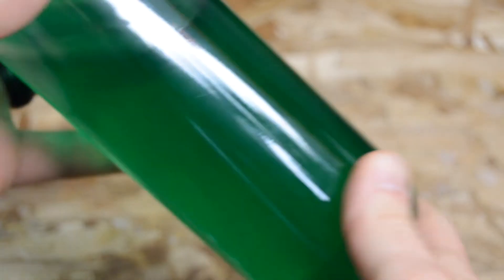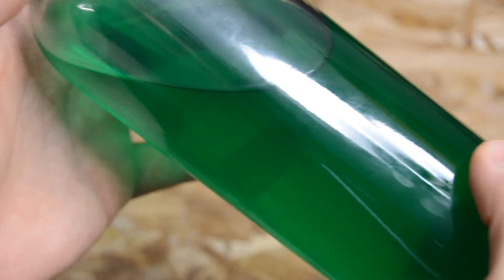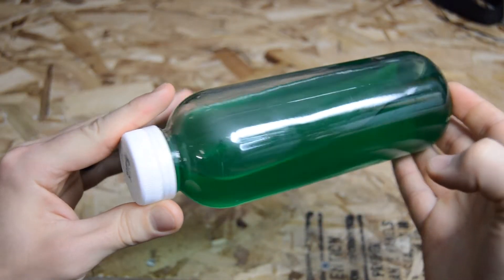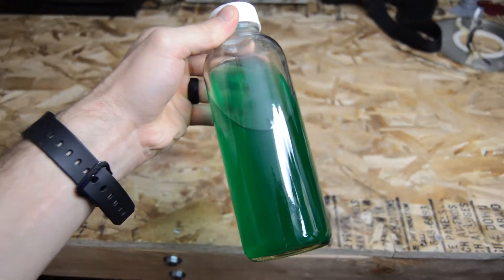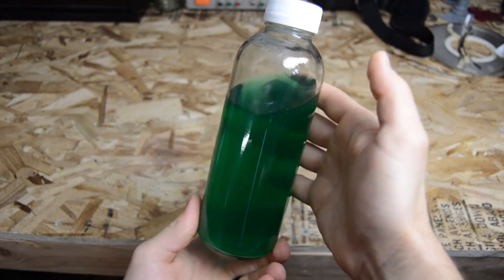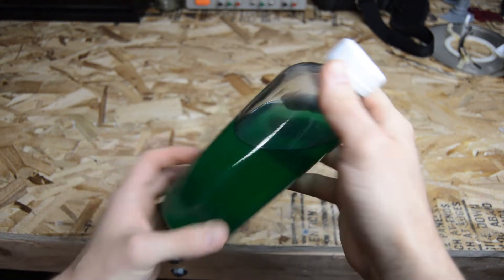Once the entire reaction has taken place you can either dilute it for use in nickel plating or do what I did and make some really cool looking nickel sulfate crystals. The solution as it is has a nickel sulfate concentration of about 0.5 moles per liter. So depending on the goal nickel sulfate concentration you want, you may already have the right concentration.